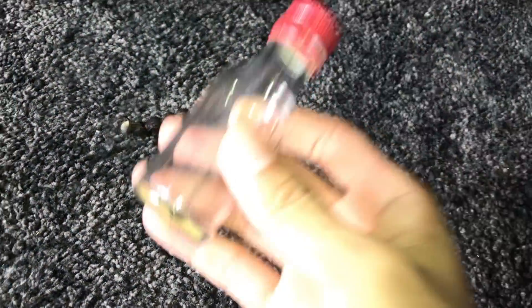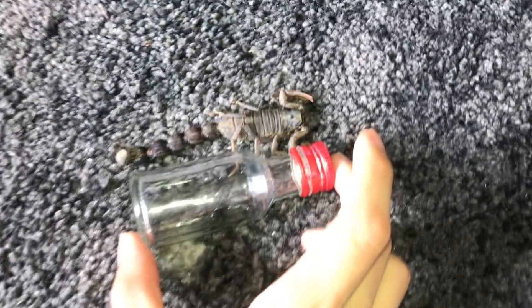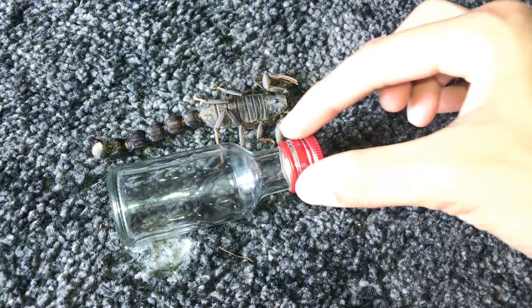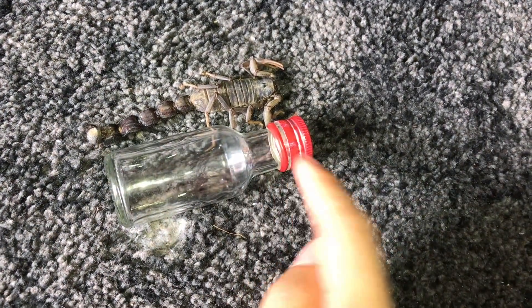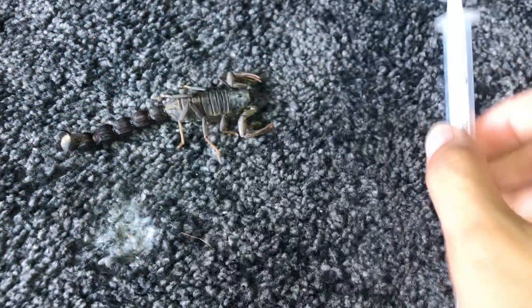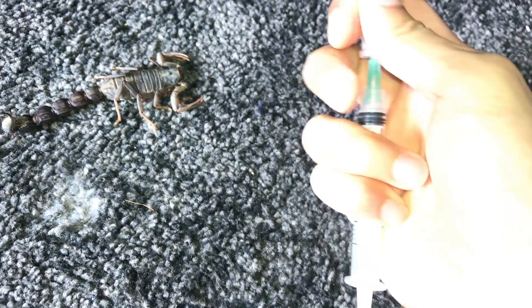I'm gonna put him in this container — it's about the same length as him, so I'm hoping he'll fit. I'll put the head end down since that part is thicker, and the tail towards the top. Before we do that, I'm going to be injecting some alcohol into the body cavity using an injection needle, because if not, it'll start to rot from the inside out.